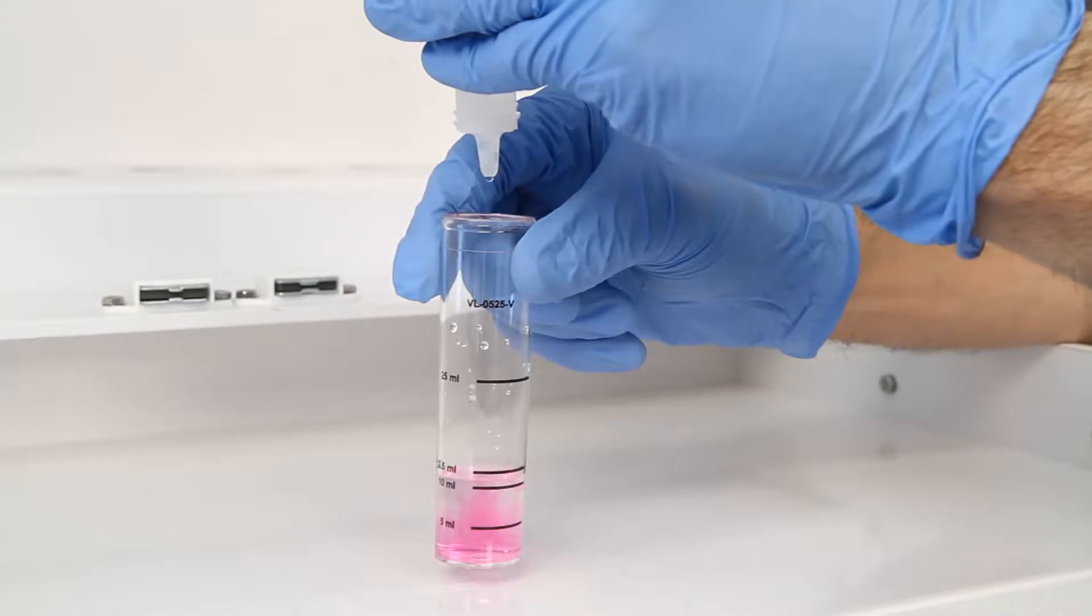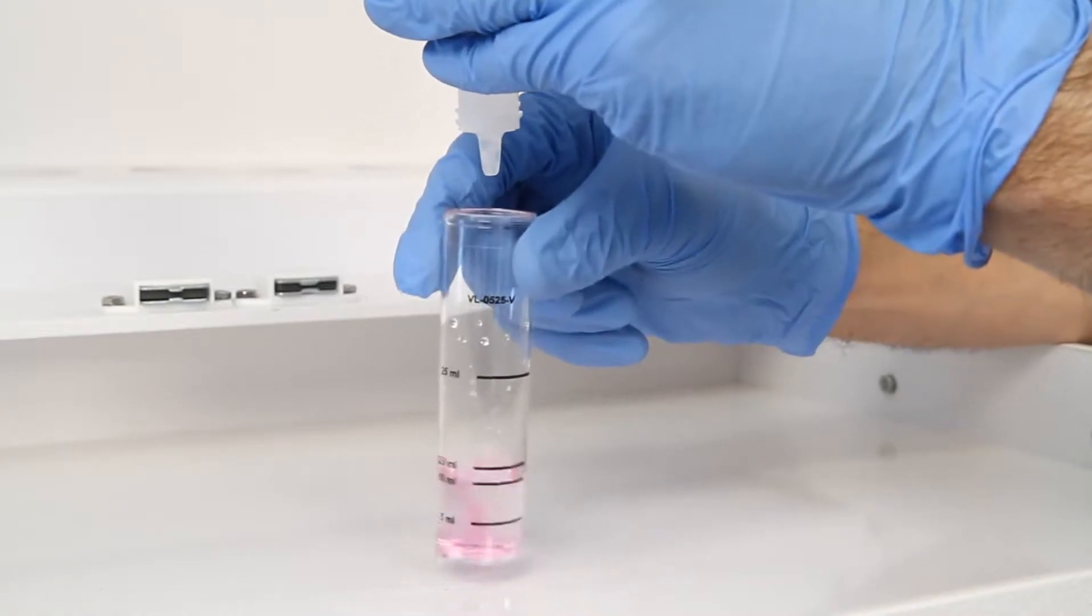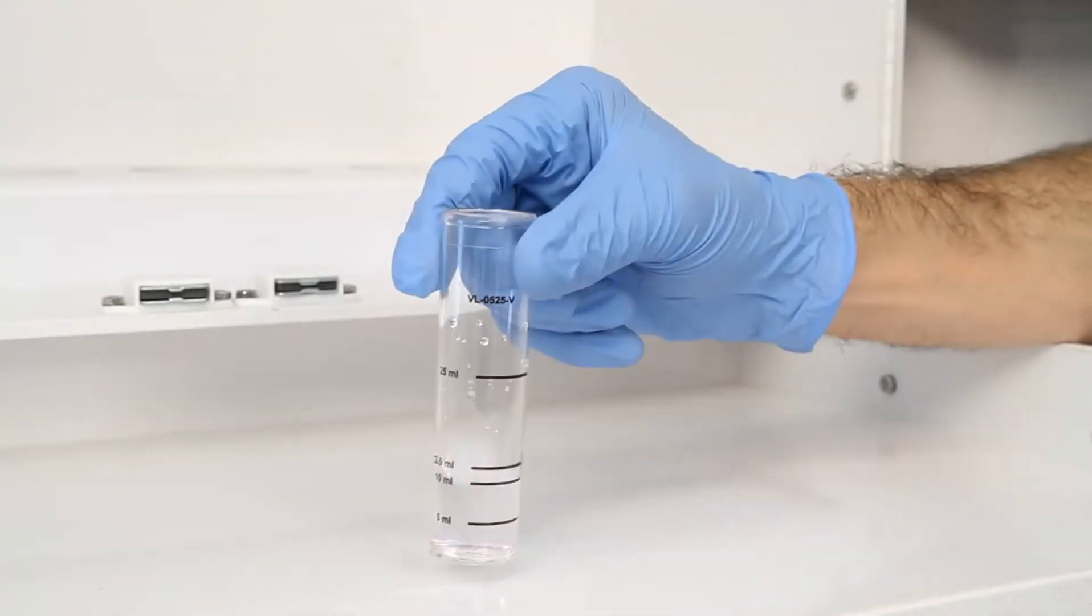According to the Endpoint ID procedure, the titration is complete when the sample is changed from red to colorless.